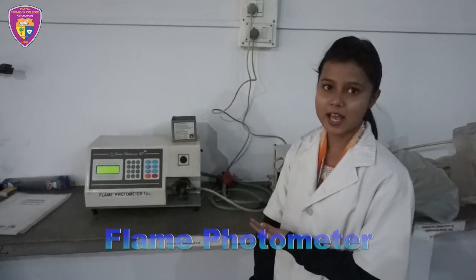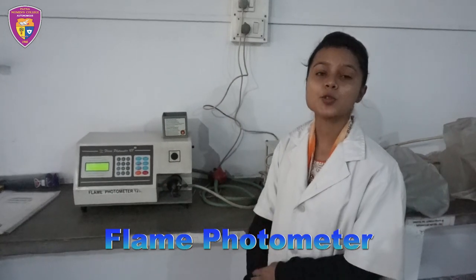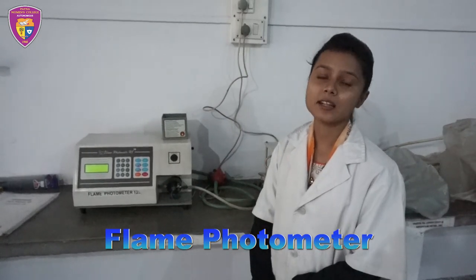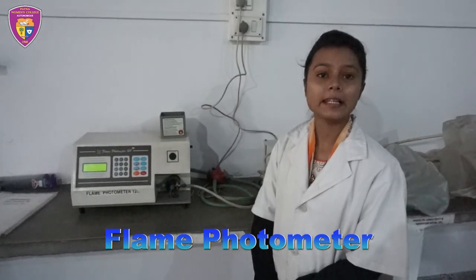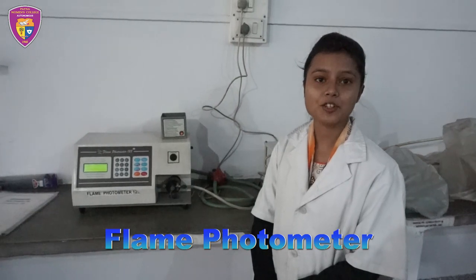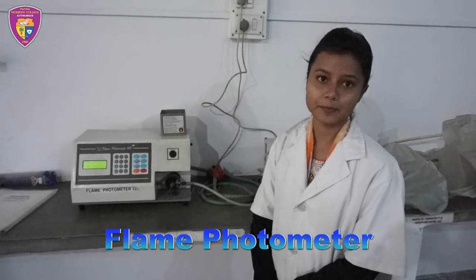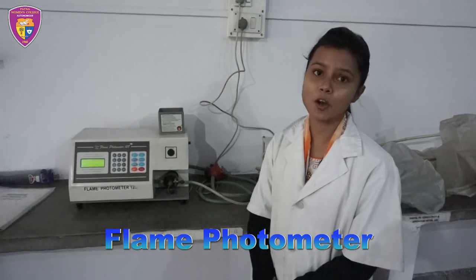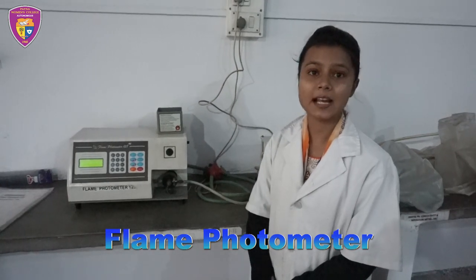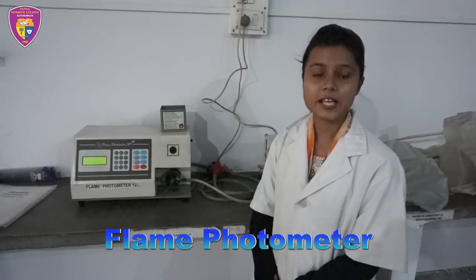This device is known as a flame photometer. It is used to determine the concentration of certain metals such as lithium, potassium, calcium and sodium. It is based on the principle of measuring emitted light intensity when the metal is exposed to a flame.